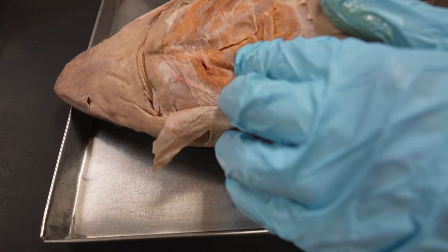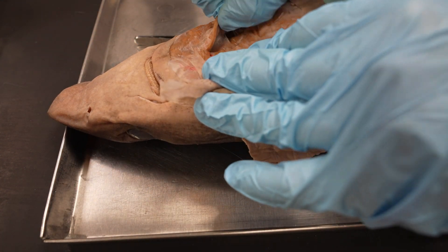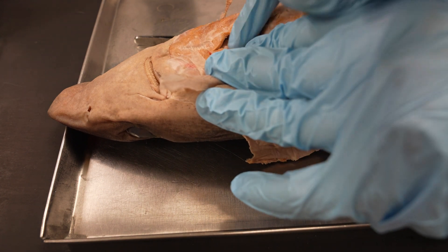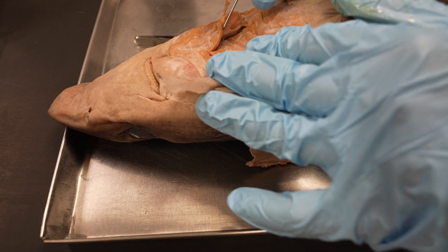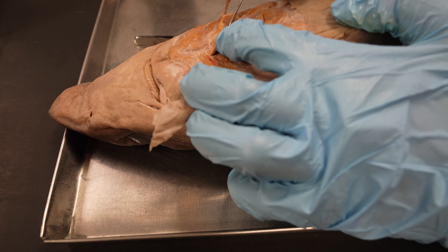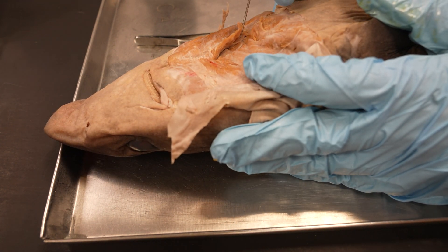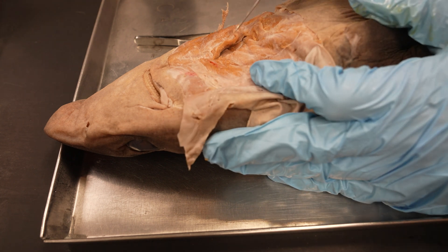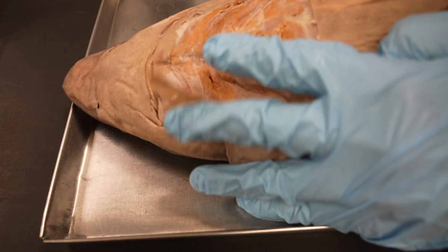So I'm going to clear those off the deep side — they're right under here. You can see it's tightly adhered right there. Just beneath my pin is the coracomandibularis. So I'm going to clear that off and then we'll come back and it should be just about done.